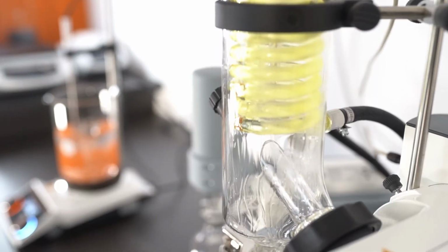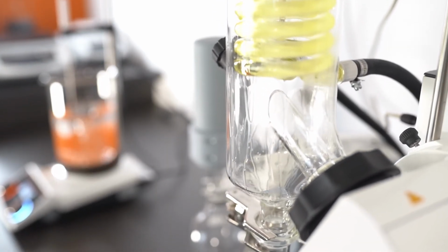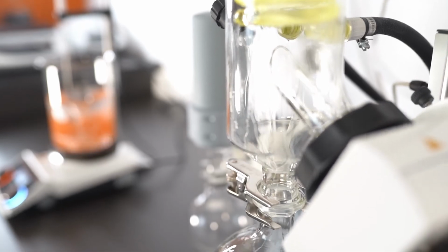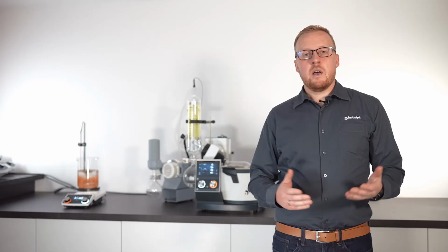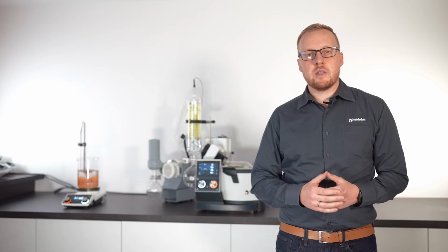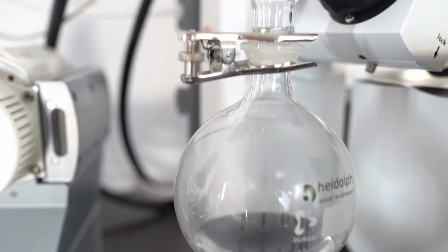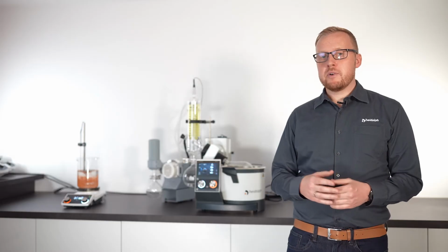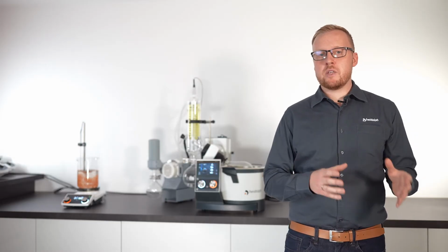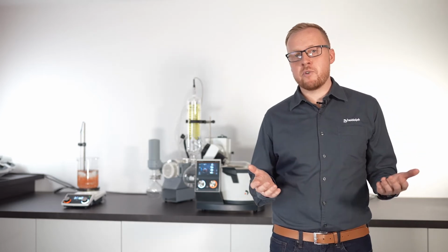As soon as the first rising vapor increases the temperature at our point of measurement, the system reacts and will keep the vacuum level, and with it the vapor load on our condenser, constant. After a while of constant evaporation, the residue level of our focus solvent decreases, and with it the created and rising amount of vapor. In a manual process, you would have to readjust the vacuum manually now, or you accept a slow and not fully completed separation.